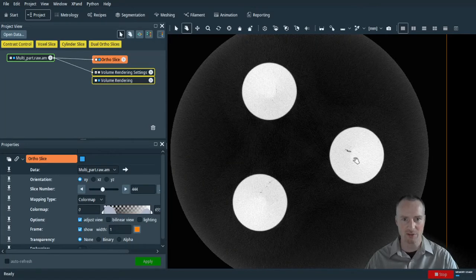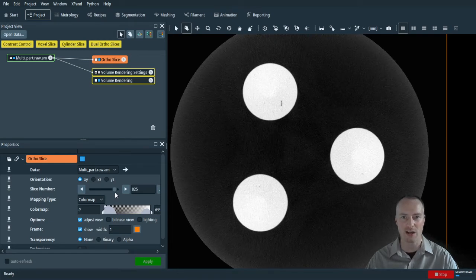We can see that we have a good contrast of the pores to the matrix material. The data also does not show a lot of noise. This is going to make the post-processing a lot easier and mean that we do not have to use any sort of image filters. I will now show you some examples of X-ray reconstruction artifacts which could cause problems in post-processing before we move on to the actual recipe creation for automated analysis.